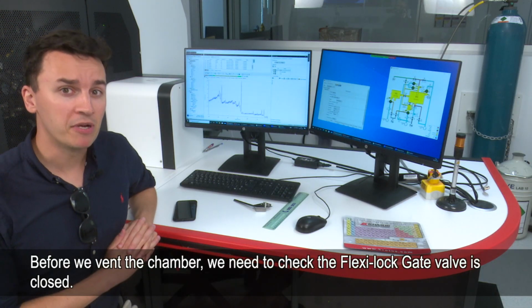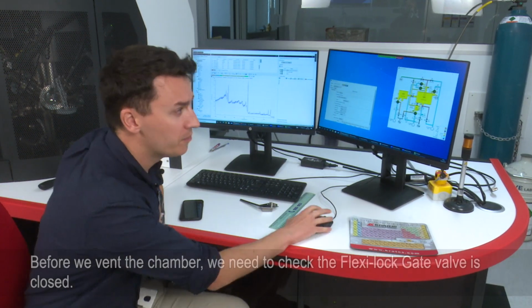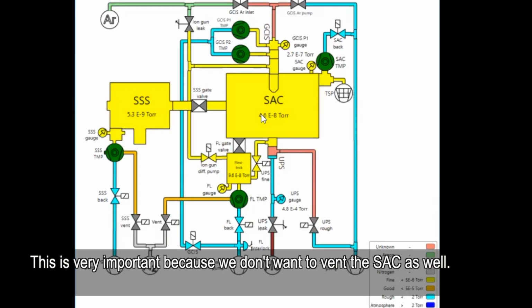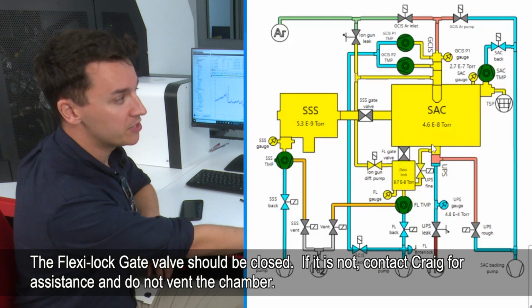So before we vent the chamber, we've just got to do a check to make sure that the Flexilock gate valve is closed. So this is very important. We don't want to vent the sac as well. It should be closed. If it's not, just come and grab me. Do not vent the chamber.